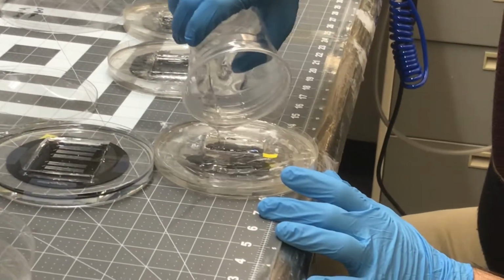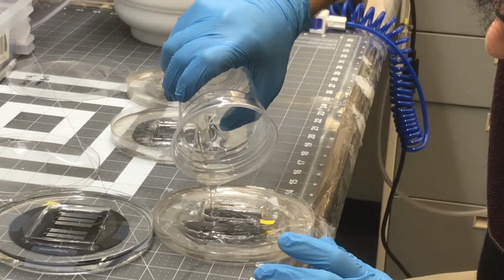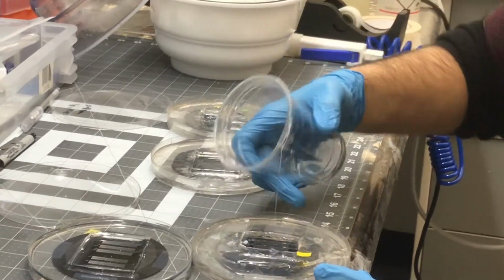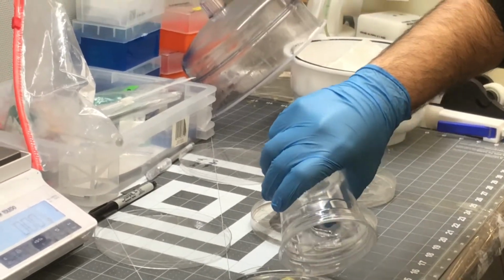When you do this part, you shouldn't even talk. This is also important because when you talk, particles go inside, which is not good at all for the chip during chip preparation. Do not talk to the family. Do not listen to music during this work. Just pay attention to your work.